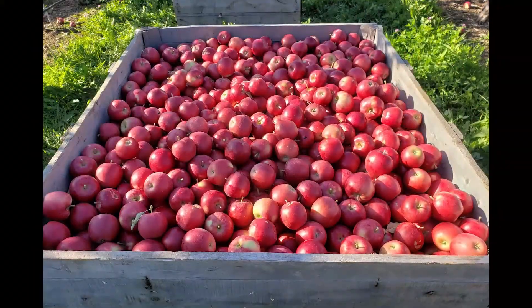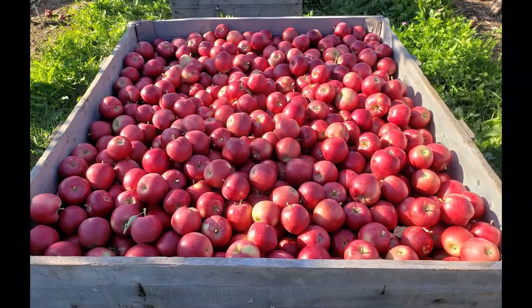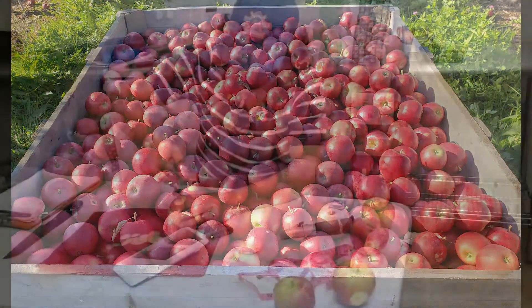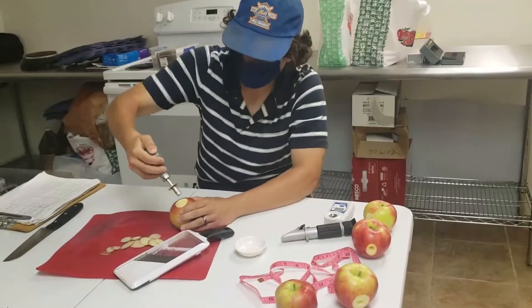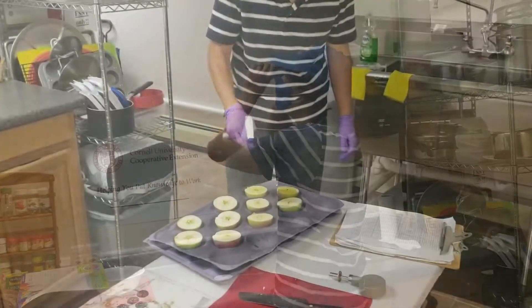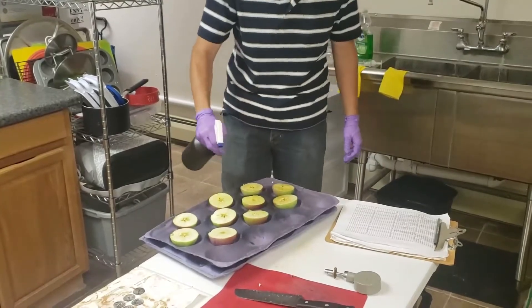To help determine when your blocks are ready to be harvested for long-term storage, there are a few maturity metrics you, or an employee on your farm, can test. In this video, we will demonstrate how you can measure fruit firmness, Brix levels, and the starch pattern index to help you key in on your optimal harvest windows.